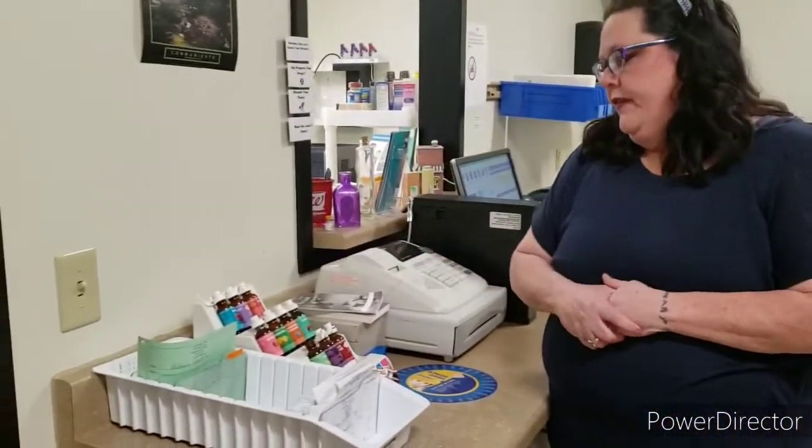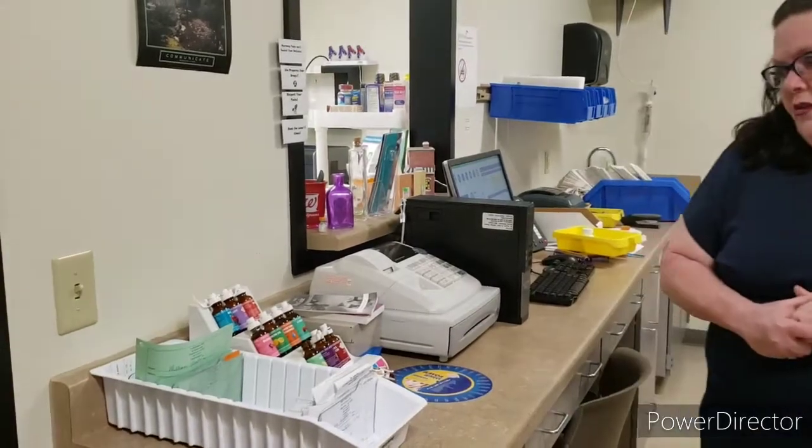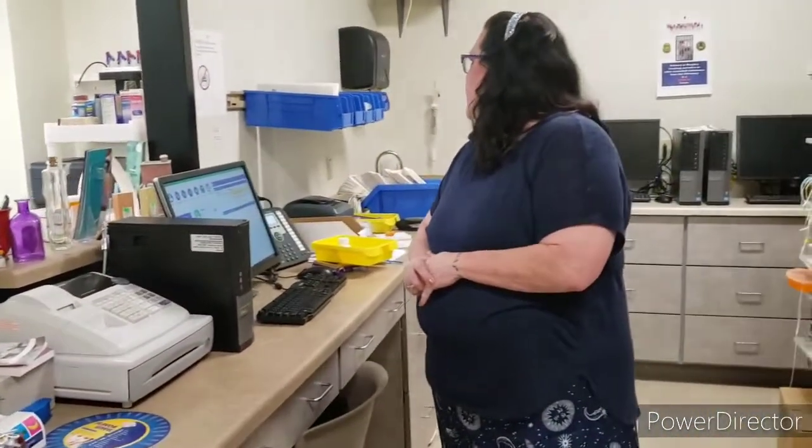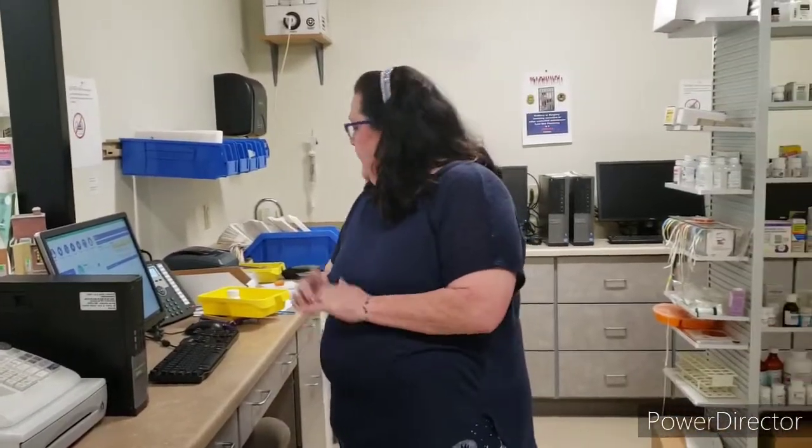So let's say we'll work with these. These are tools. We have some flavoring. That's just fun. Sometimes kids and adults like a different flavor. We have many other tools back here that we'll learn how to use. But that's the basics.